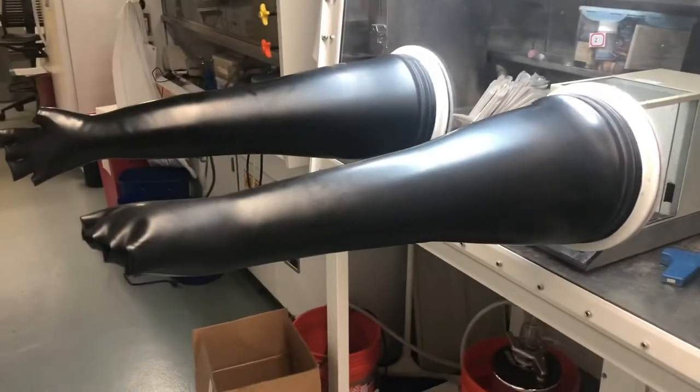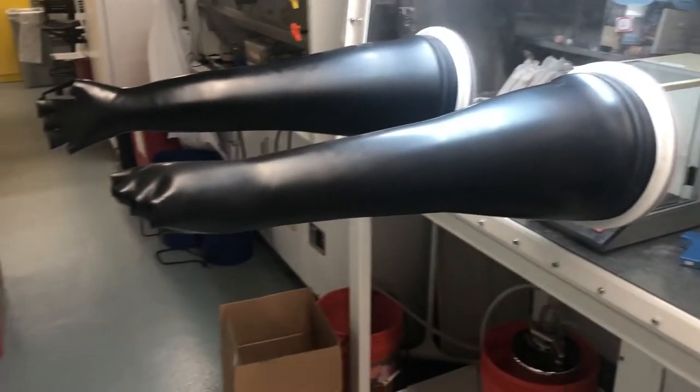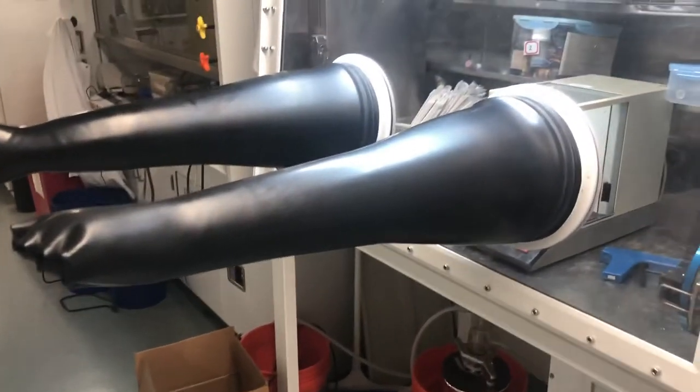It is important that you wear a lab coat because your arms will stick to these gloves otherwise. And we don't want that. You want to be able to slide right in there. That's why we use cotton gloves on top as well.